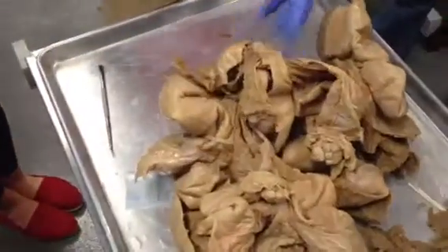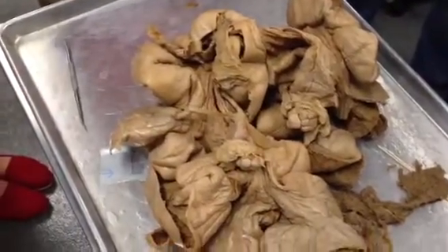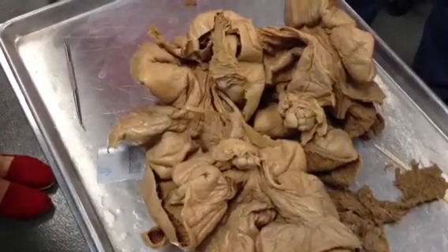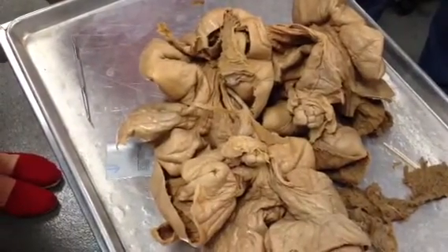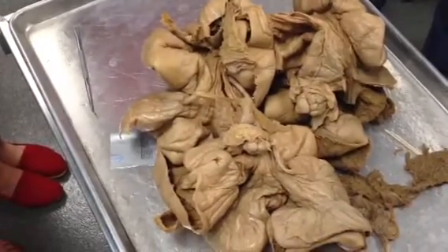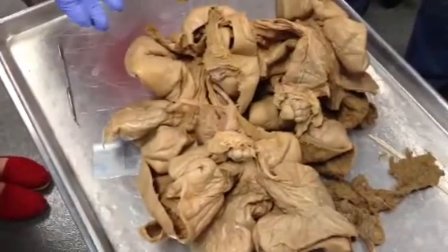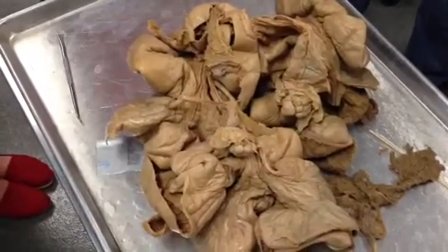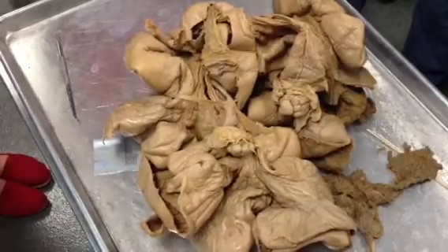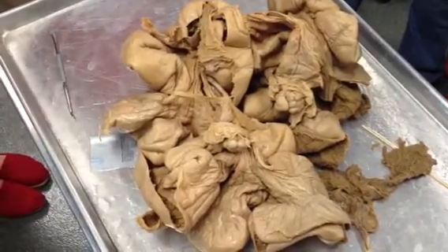Human, as you saw the pictures, kind of had a uterus that looked a little like a pear, and then it had the two tubes coming off, right? The oviducts. The pig uterus isn't like a pear, it's like a cervix or a vagina, and then two uteruses that go off, and they're called uterine horns, because pigs have a lot of babies at once, so the babies don't just grow up in one compartment, there's actually two going left and right, but they're not oviducts, it's uterus, so it kind of has a Y shape.